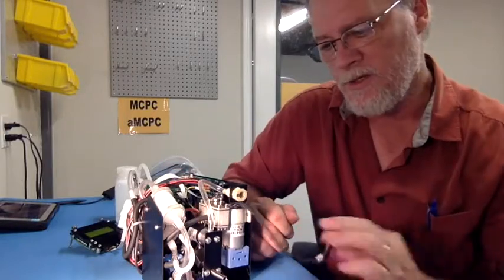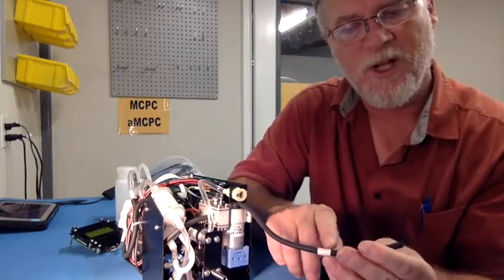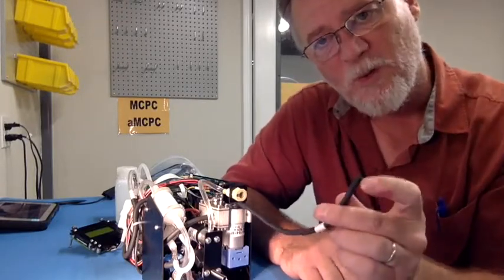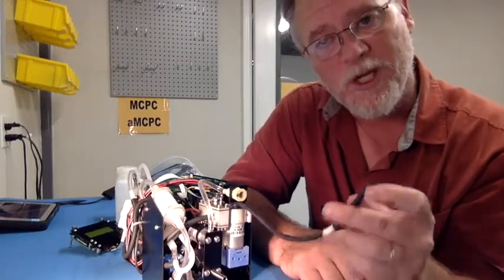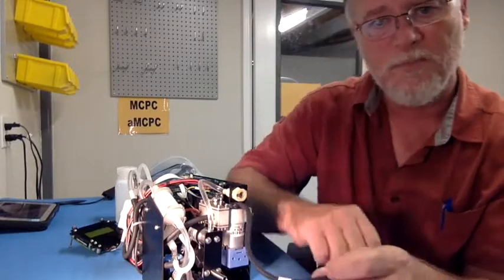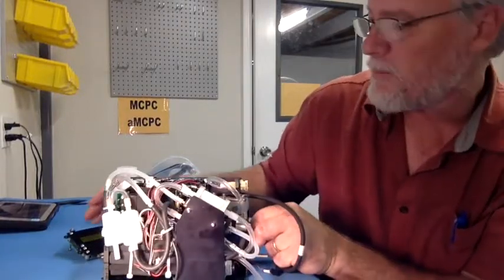optics block. So this tube here, which is labeled exhaust right here, has butanol airflow coming out of it. And you need to route this tube to either outside or a fume hood or somewhere where air with butanol can go so people don't breathe it. Okay, that's very important. Okay, so what else can I show you about this unit before I actually power it up?